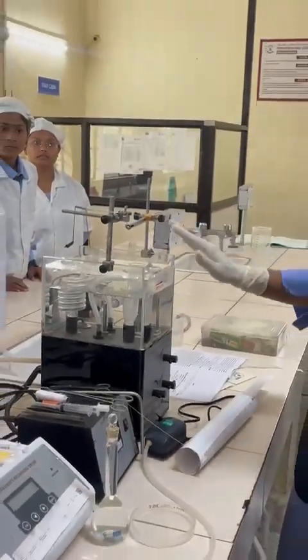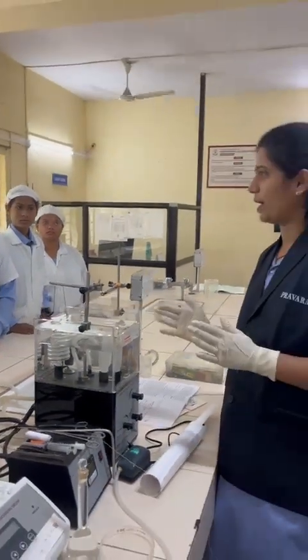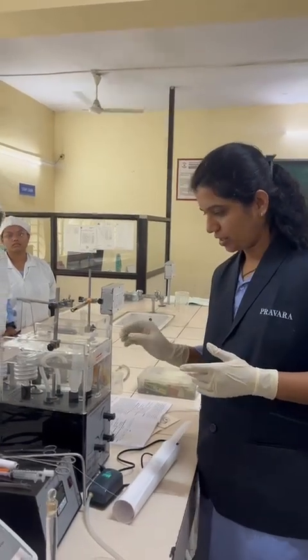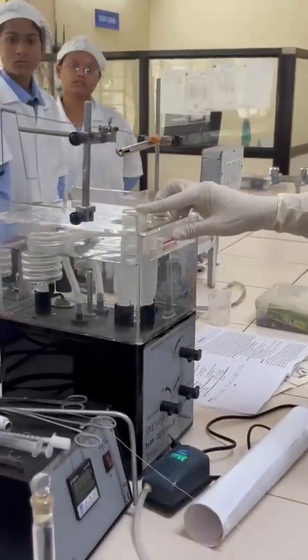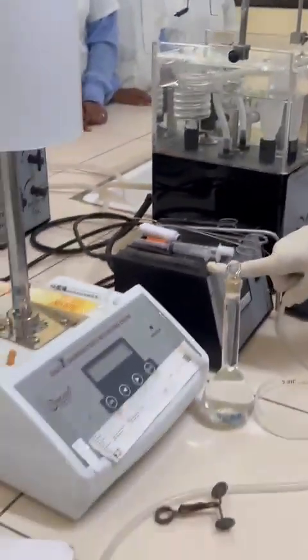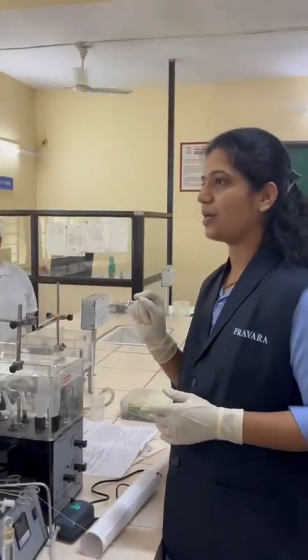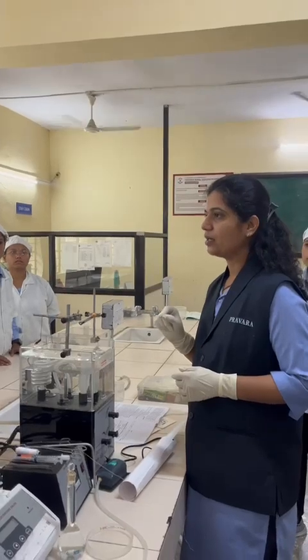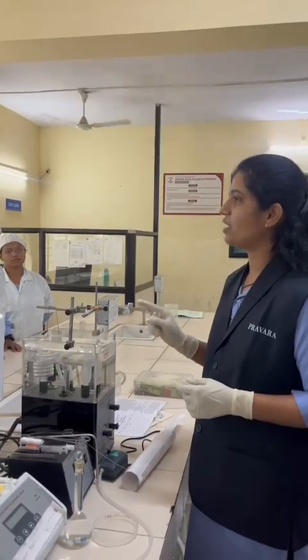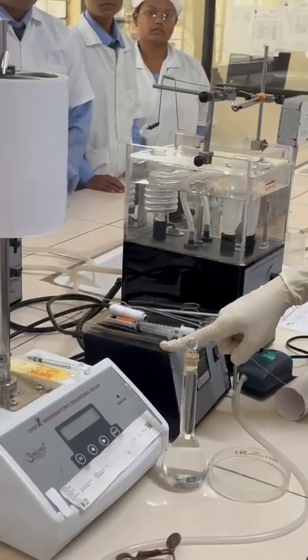Again there is one organ bath. What is the organ bath? You can simply say the water bath. Here we are maintaining the temperature of the tissue by using the water. Here is one organ tube. Second, the organ bath, then the temperature controller, that is a digital temperature controller. As we know, the normal temperature for the tissue in the human body, what is the normal temperature? 37 degrees Celsius. So here we also maintain 37 degrees Celsius. It is a totally automated machine, with no requirement for setting up the temperature.